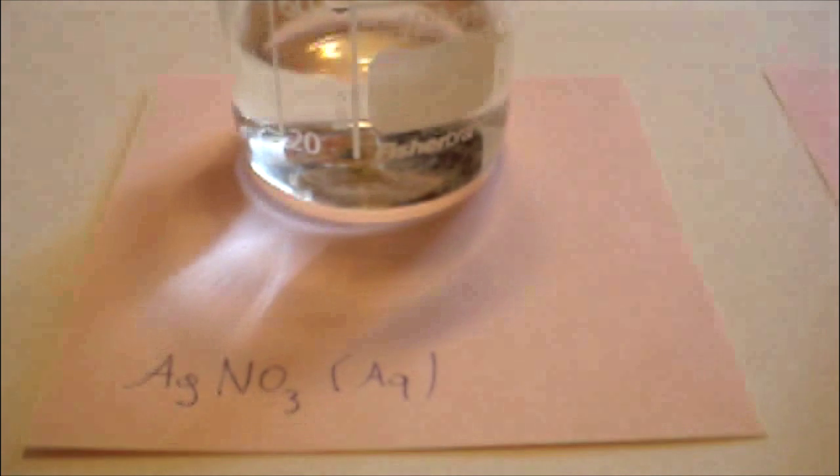Here is the silver nitrate. Make an aqueous solution of silver nitrate by dissolving two spoons of silver nitrate into 50 milliliters of water.